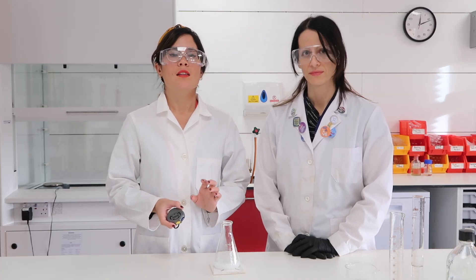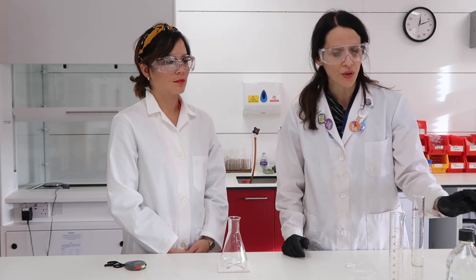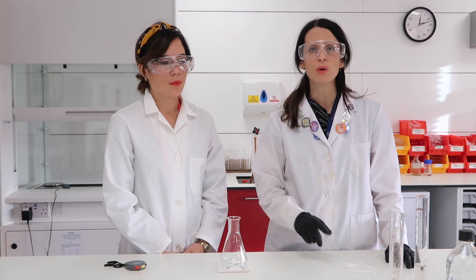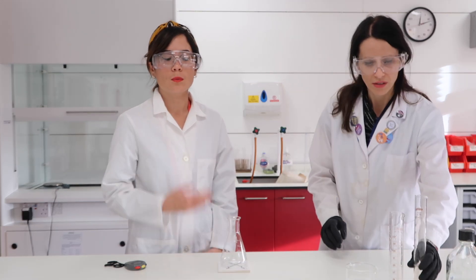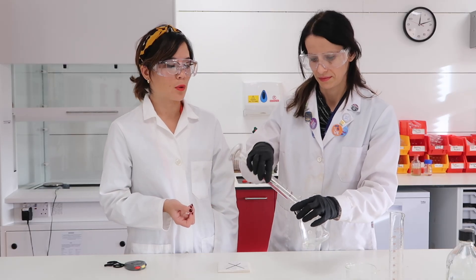Now we're going to try the same experiment, this time with a high concentration of sodium thiosulfate. We're going to add 40 cubic centimetres of sodium thiosulfate and 10 cubic centimetres of water, then add 10 cubic centimetres of hydrochloric acid again. We're using a much stronger concentration this time, so we would expect the cross to be obscured far more quickly.